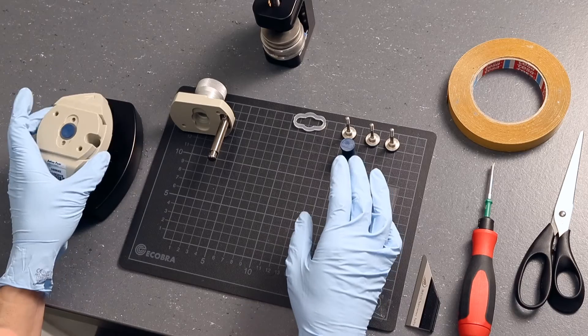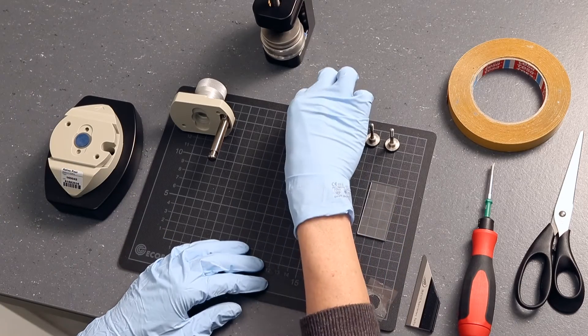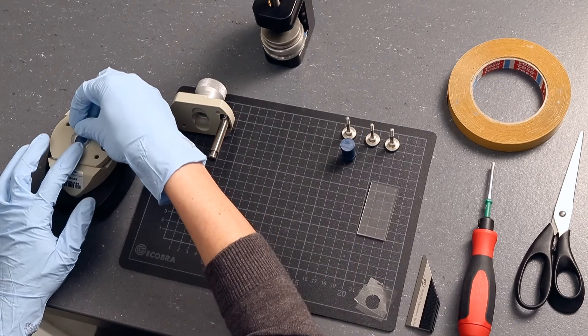Place the lower half of the cell on the pedestal. Insert the spacer gasket into the recess of the cell.